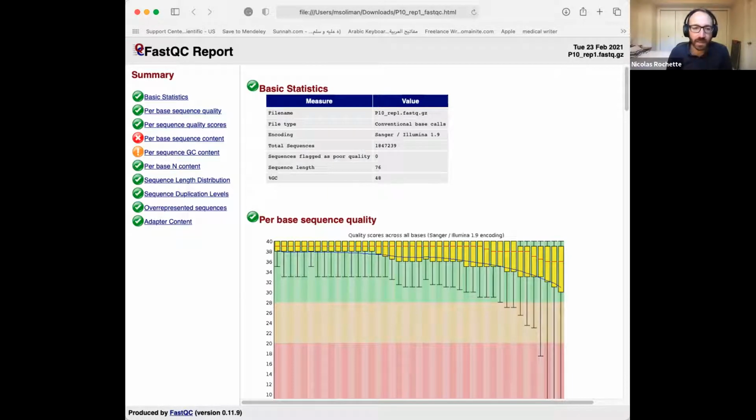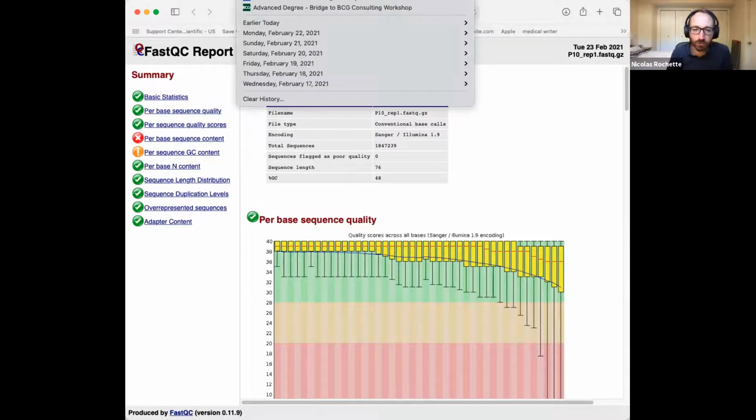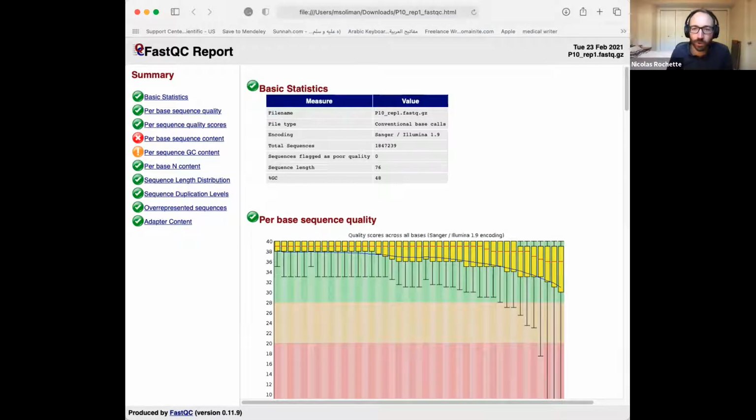Sequence lengths, and then it also gives you the overall GC%. And so the first histogram it gives you is like, what are the scores? What are the Phred scores? So between 0 and 40, what are the Phred scores from the first base to the last base of the read? So from base 1 to base 76, what are the quality scores like?